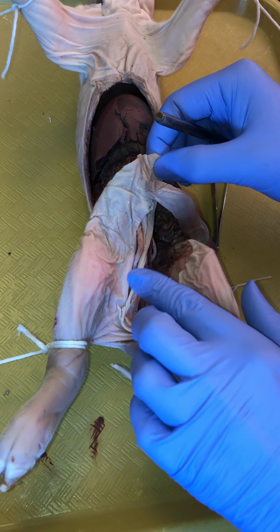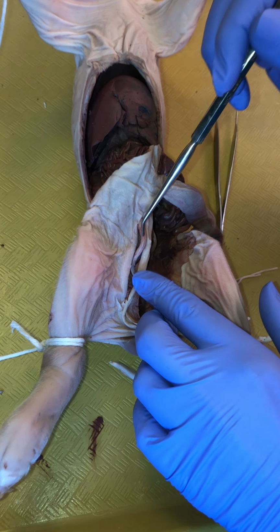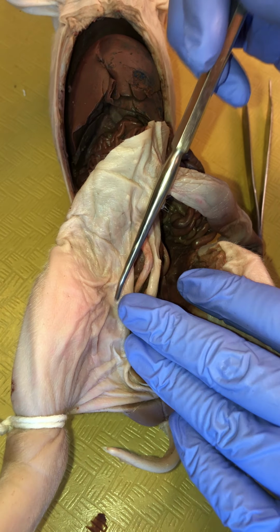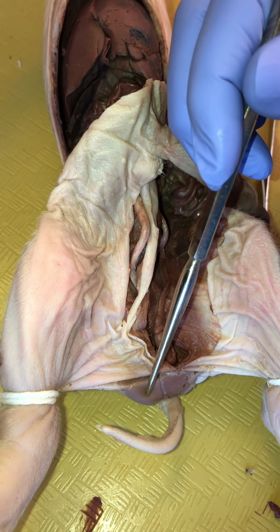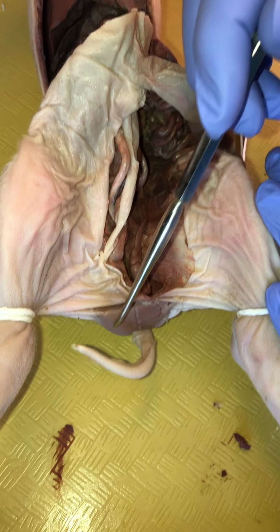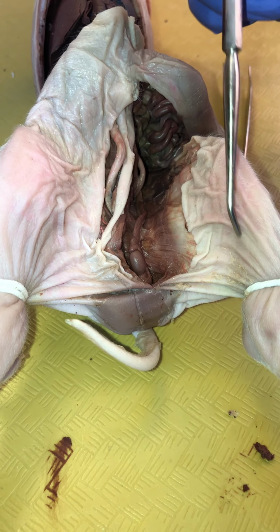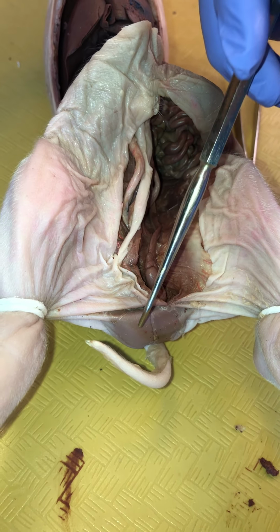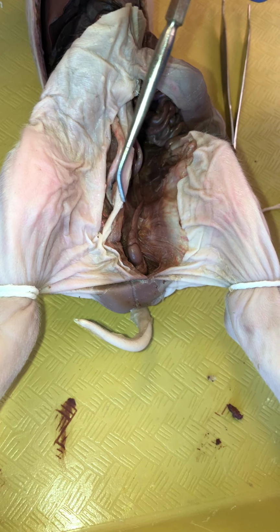We already know that we've, well, right, see there's our paired pelvic teats, so we can see that we're in the skin here. Notice here the skin is intact, and when we did the external anatomy, we saw the scrotal sacs, and they're dark here, but again, this is the male that had all of that bleeding out. So his whole coelomic cavity, and this illustrates the fact that the scrotal sacs are also part of the coelomic cavity, actually invaginates into them.